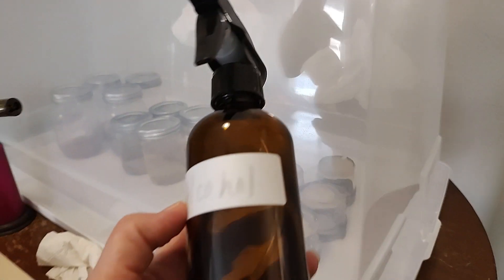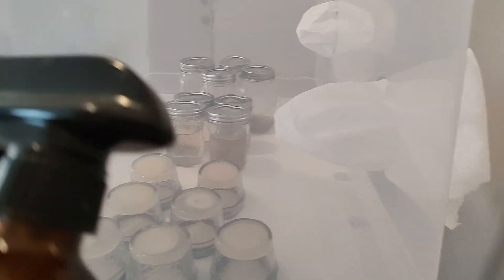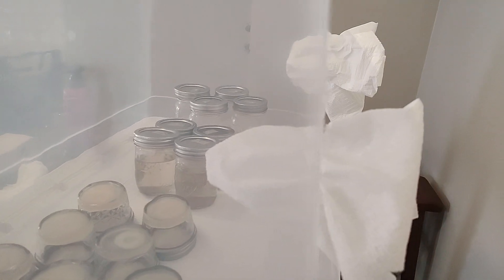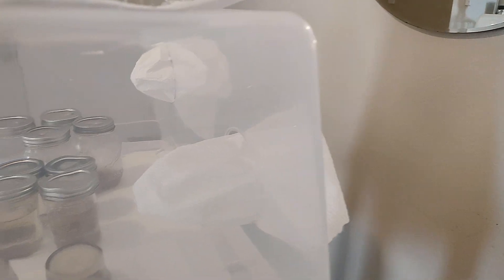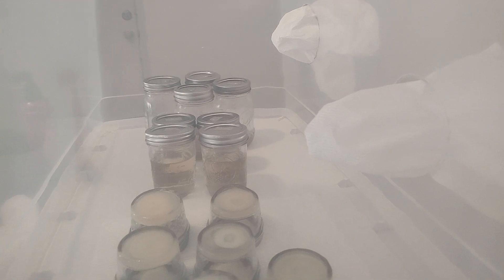One tip I've been sharing is I use these paper towels in the armholes. I use 91% alcohol and I just refill this spray bottle — I like to say it's self-cleaning. I spray, spray, spray. I have a video on this showing you. Then I put the paper towels in the armholes and I actually scoot the table against the wall so air is not getting in.